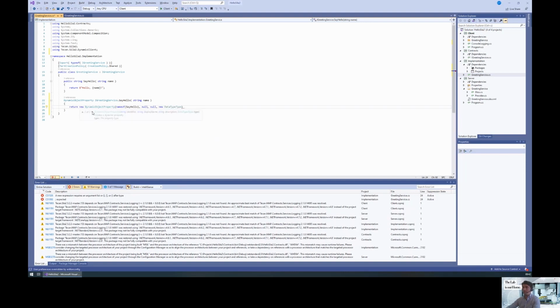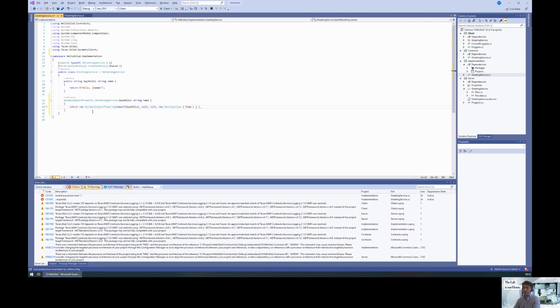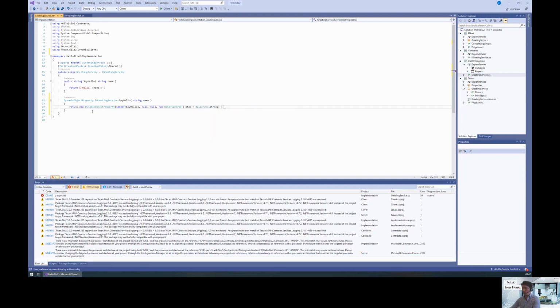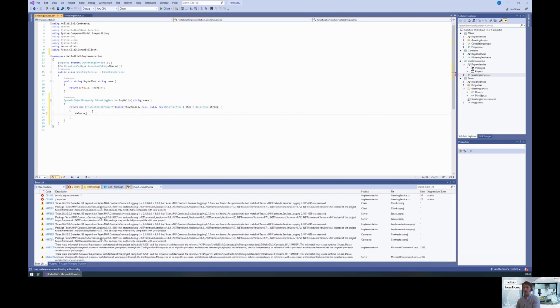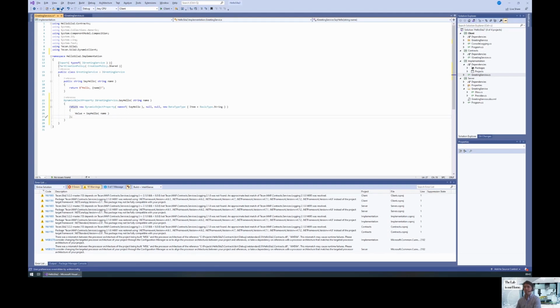And then the data type. And the item will be just, okay, we will return just a string. So just a basic type string. And very important, the value is just "Hello" plus the name. So the normal greeting that we had before.